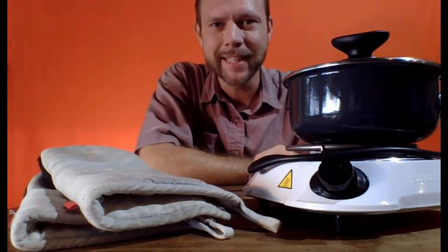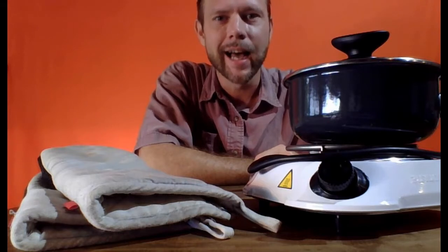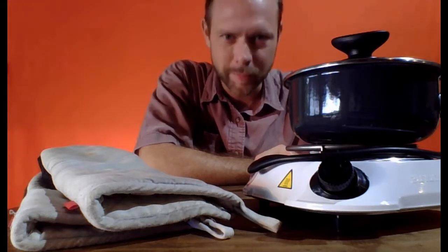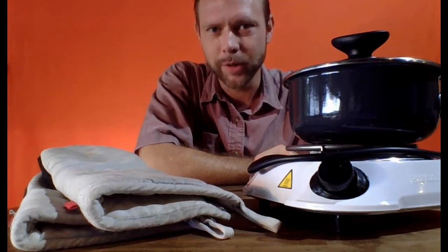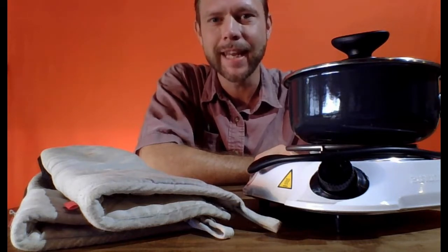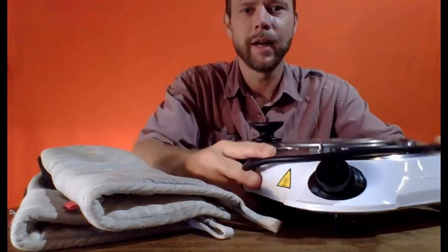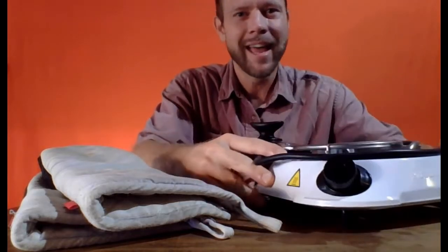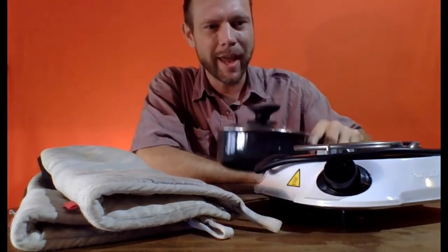Okay, so that being said, the main thing we're going to do in this experiment is heat some substances. Specifically, we're going to be heating some salt water, boiling off the water, and we're going to need some sort of heating element. And you can see here what I have is a pot on top of an electric burner. Now, this is exactly what you don't want to do. This thing is way too hot.